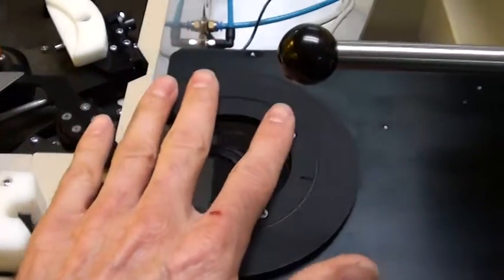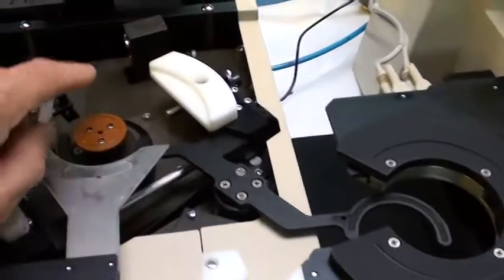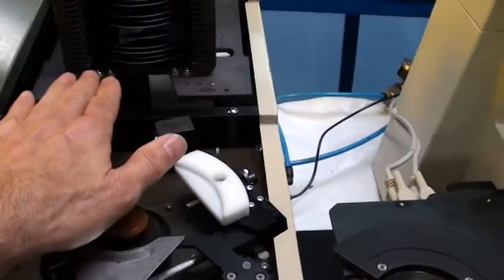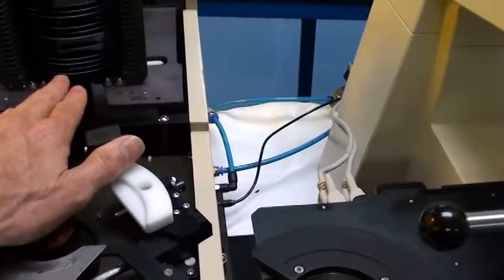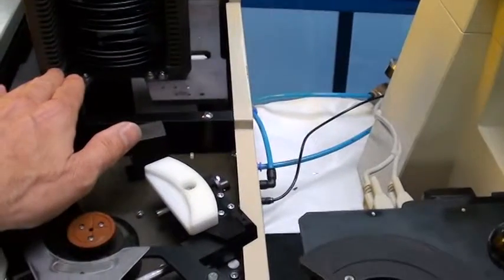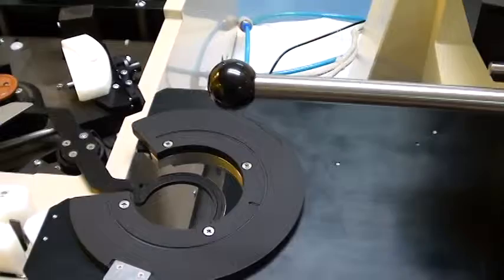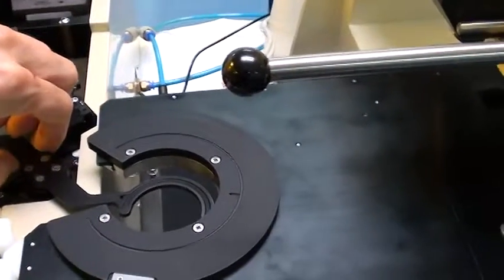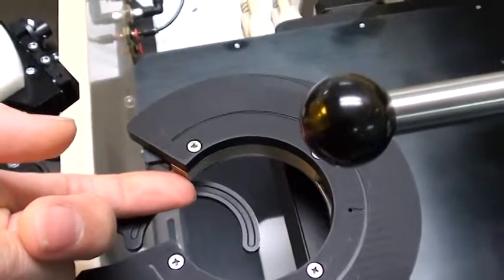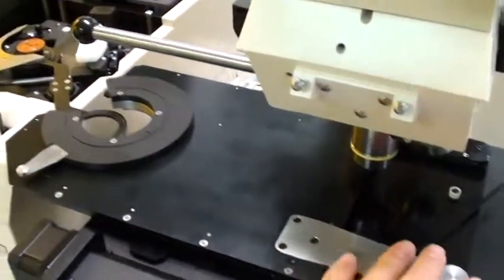It's critical that this is pushed completely to the left because when the wafer is transferred from the chuck, it has to be centered over this arm. If the wafer is not all the way over when it transfers, the wafer will be off-center on the arm, and when the arm rotates back around it will try to put the wafer back in the cassette slightly off-center. For a typical wafer that's not a problem, but these wafers, being as thin as they are, if the edge of the wafer bottoms out in this slot, it will break the wafer. So make sure the arm is completely over. Never move this arm while in the transfer process — the arm will lift up and has to fit through this opening. If you're off-center, when the arm comes up it will hit the bottom of the stage and the chuck assembly, bend the arm, and damage it so it won't pull a vacuum after that.